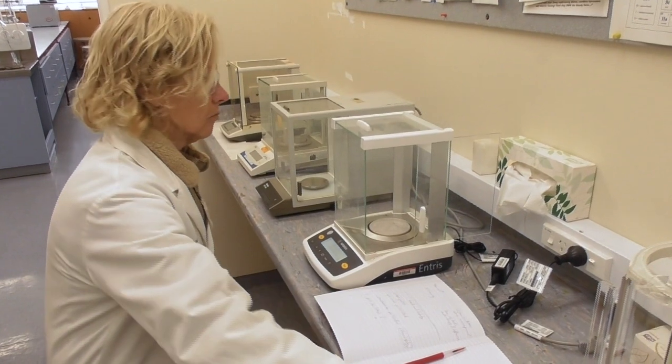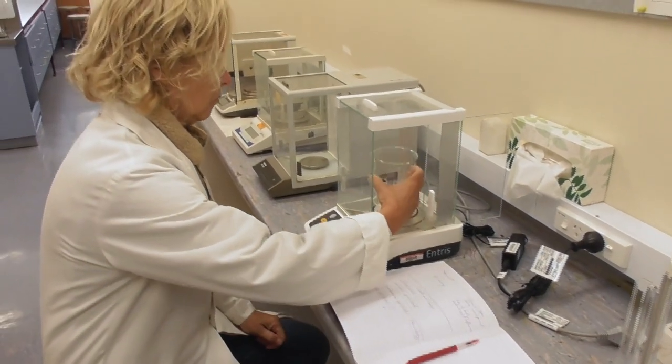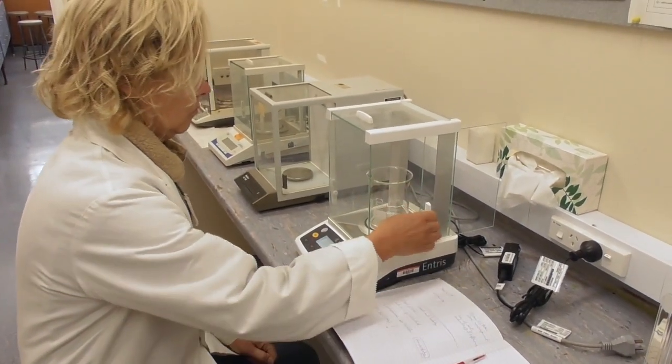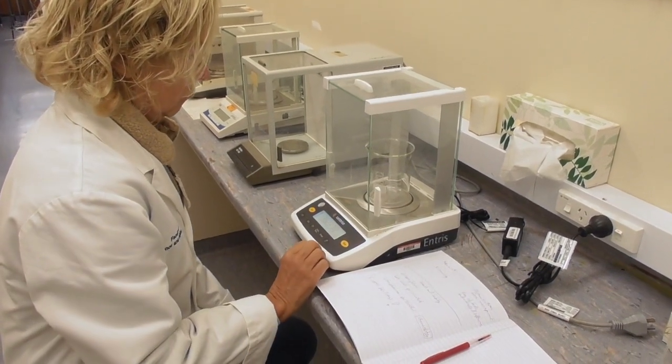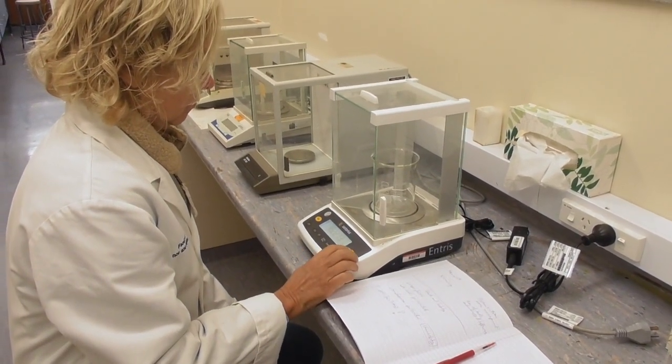In the balance room I put a 400 milliliter beaker onto the analytical balance and then tare the balance.